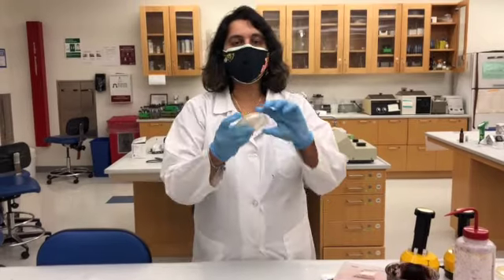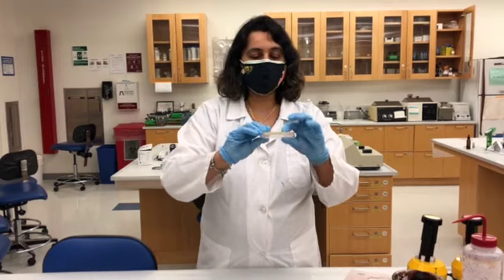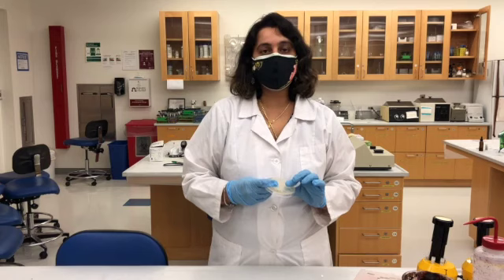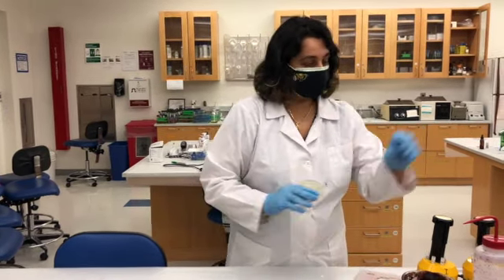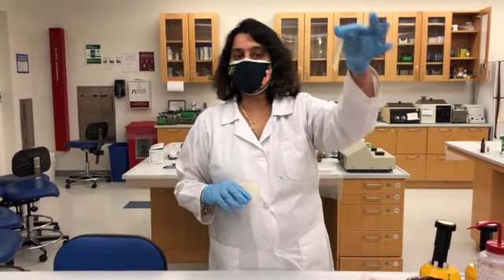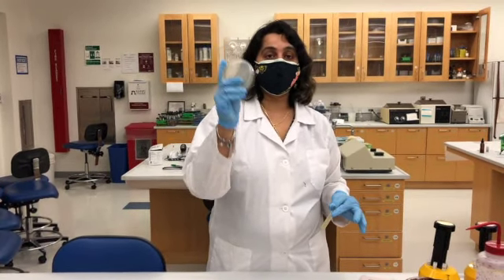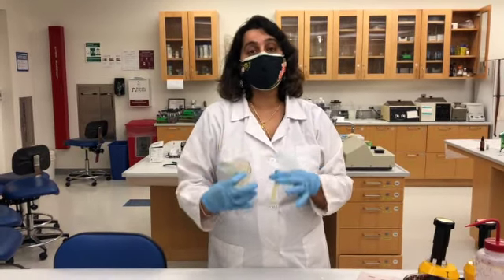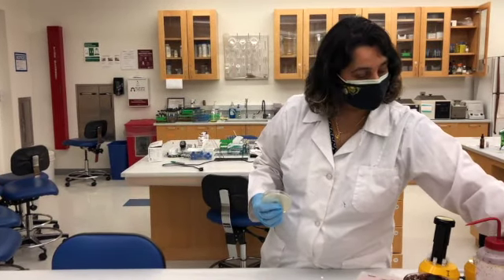So you label the plate with the name of the bacteria, with your name, and then incubate upside down at 37 degrees and check for the growth after 24 to 48 hours. So this is how you can definitely confirm that your bacteria, whatever you're growing, whether it is E. coli or any unknown bacteria, is viable. Only if you see growth on the plate, they are viable. Simply by looking at the absorbance, you cannot judge whether the bacteria is alive or not. Okay? All right, so we are done with the first exercise.